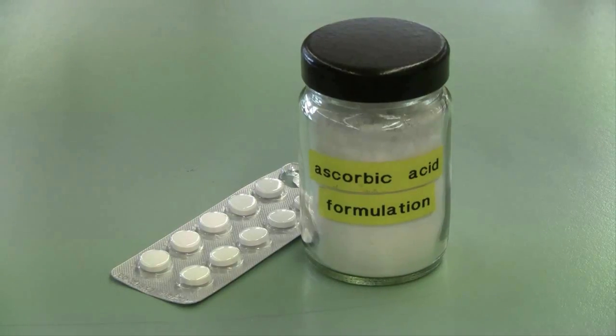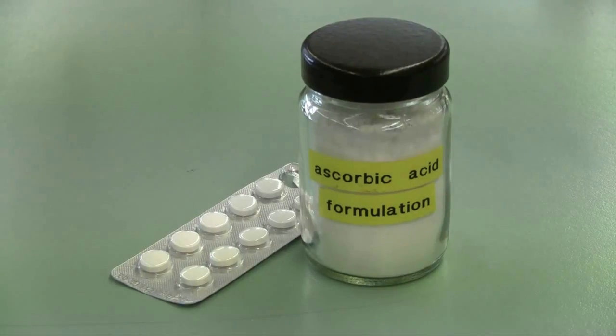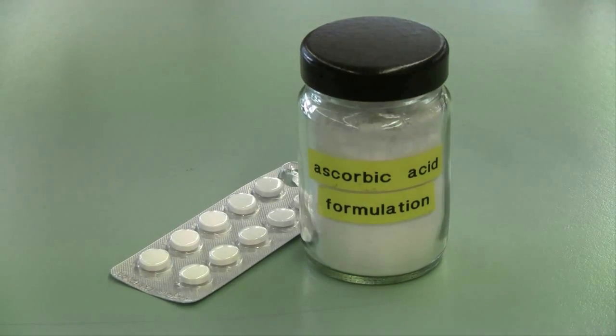Today we'll be testing an ascorbic acid formulation. Our goal will be to ascertain the percentage mass of ascorbic acid in this formulation, and we'll be doing so via an acid-base titration.